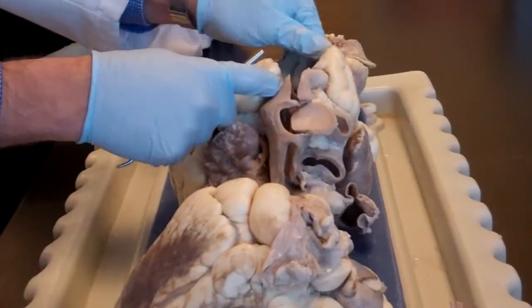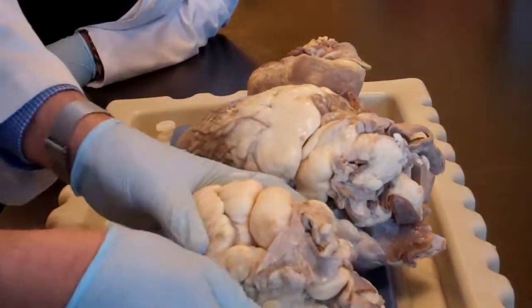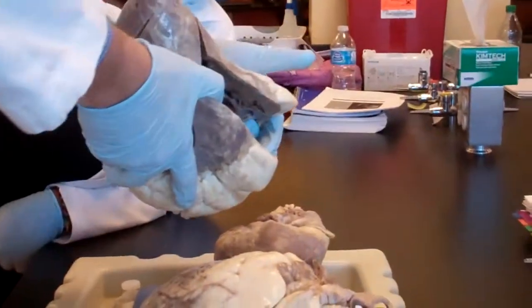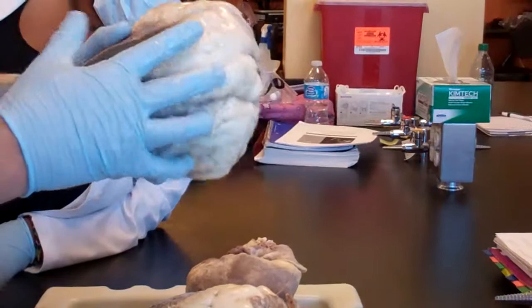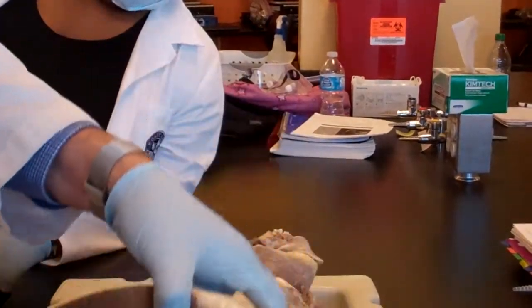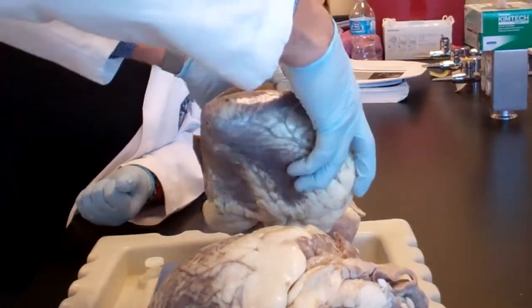Anywhere you cut, you should see the coronary artery, except this one. That's an exception there. Here, I can hold the whole thing. See, on the side here, in the middle of the fat. You see the coronary arteries piercing everywhere, and you cut it here. That's the other one that you cannot see. Here you can see it very clearly. And it's on this side too.